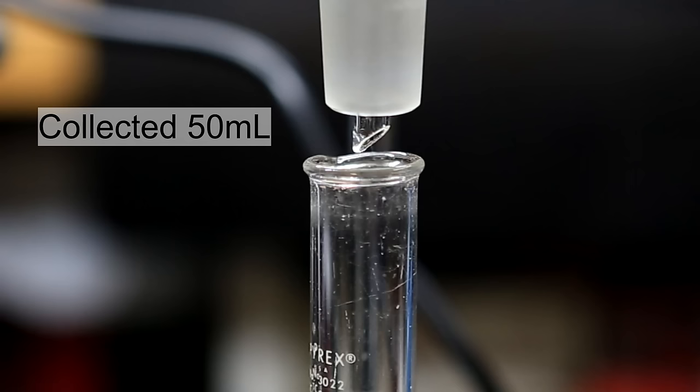Once distillation is started the distillate will start coming over and we should in theory see two layers forming.